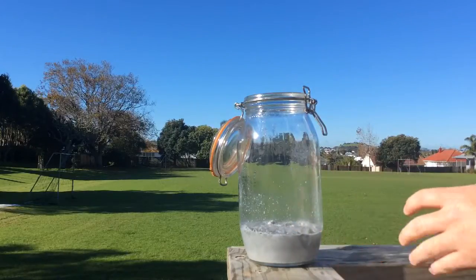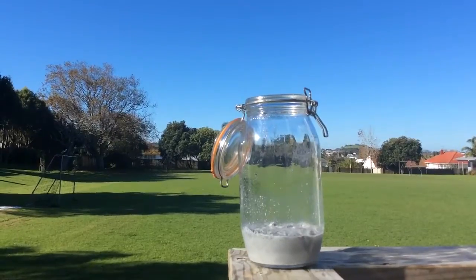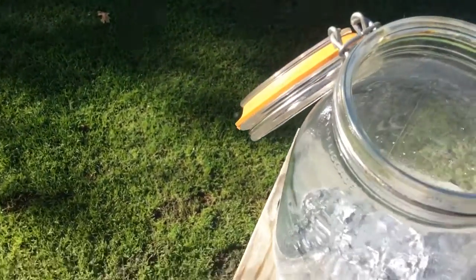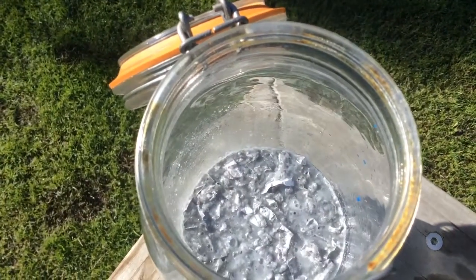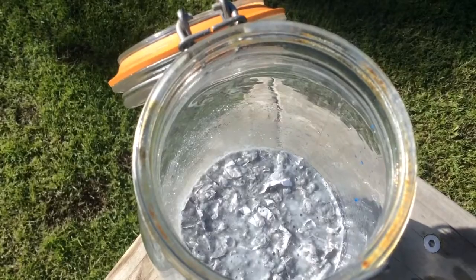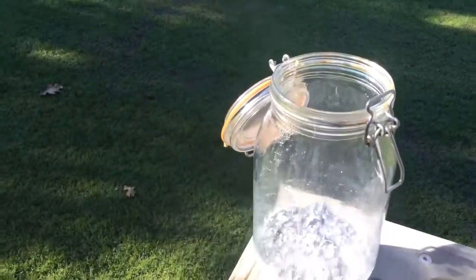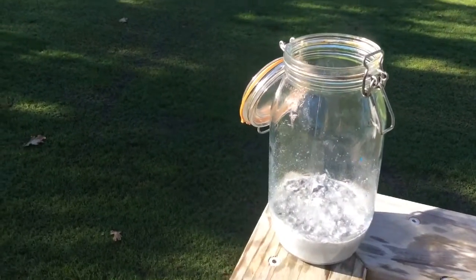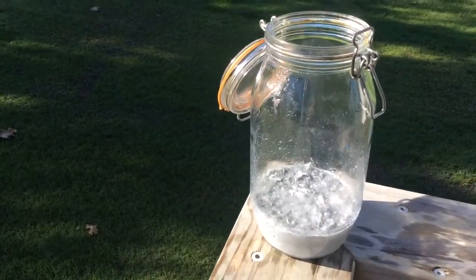Now I'm going to show you inside the jar now. Basically what happens during this reaction is that the aluminum decomposes. You can see there that effervescence and that fizzing. That's the hydrogen gas being formed with my secret powder and the aluminum shavings, plus the water.